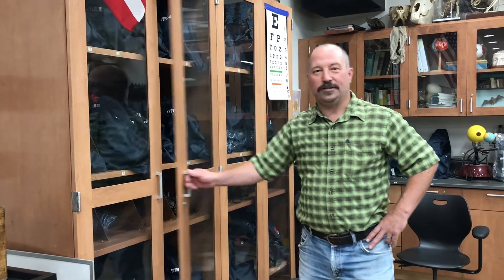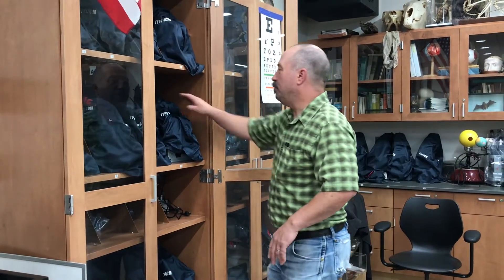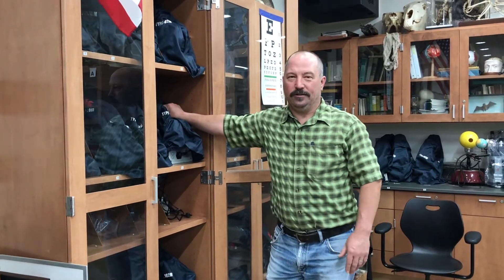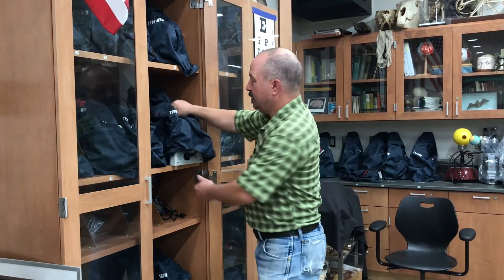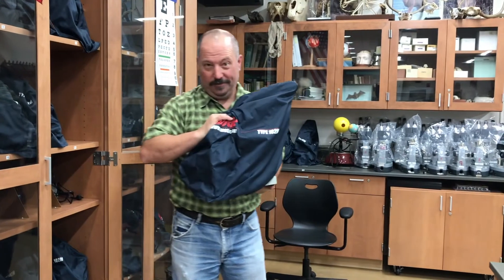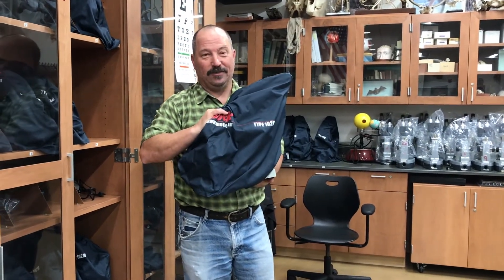The first thing you need to do is get your microscope. It's very important that you grab it by the handle — there's a handle that's made just for it. Always carry the microscope with two hands. It's very heavy and it's a very precise and expensive instrument.